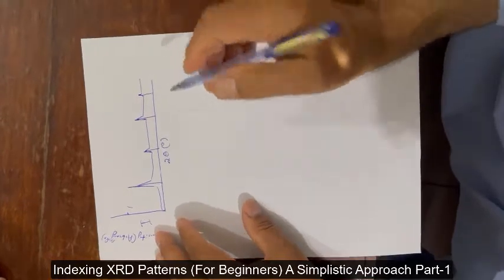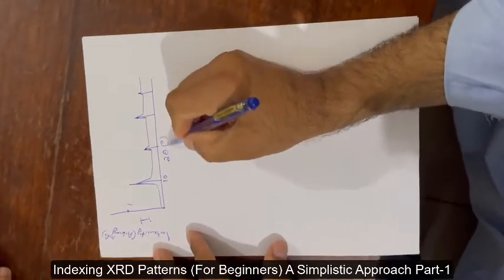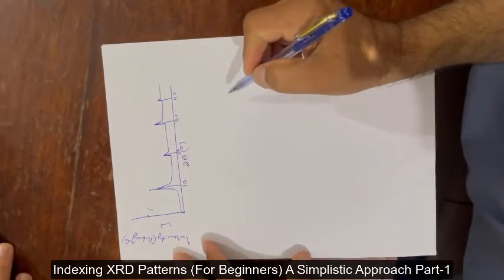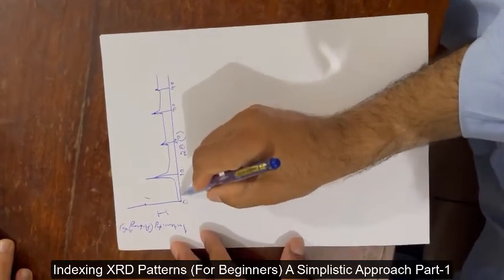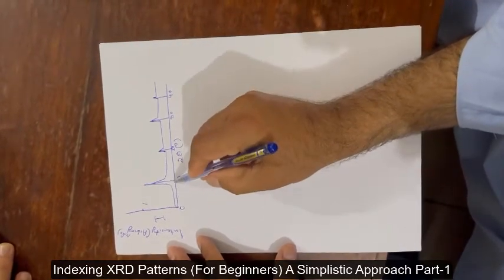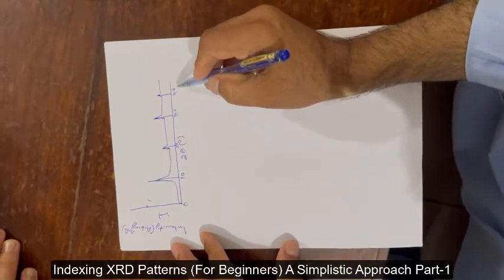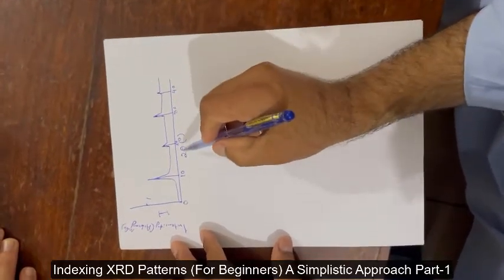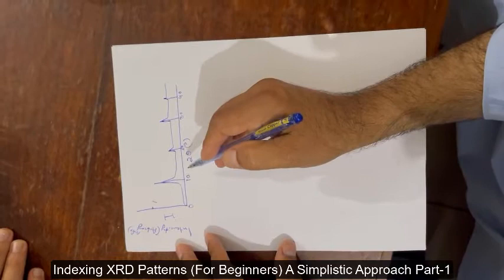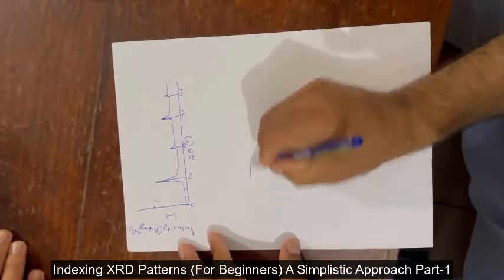These peaks correspond to specific planes of the unit cell. For example, this is 10, this is 20, this is 30, and this is 40. When you move away from zero towards higher angles, the value of interplanar spacings decreases, because interplanar spacings are expressed in reciprocal space — higher d-values appear at lower angles.